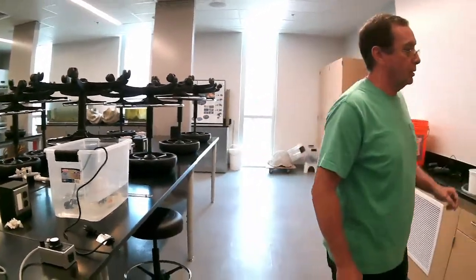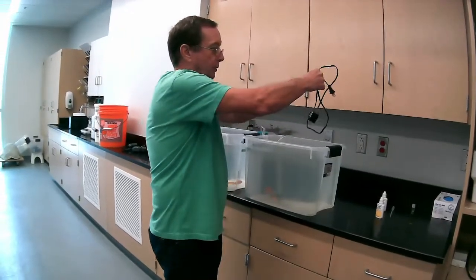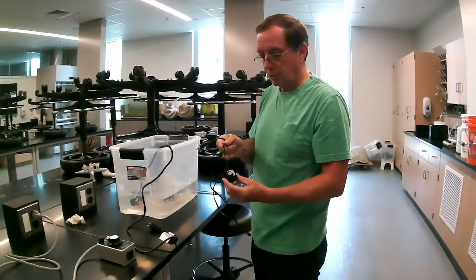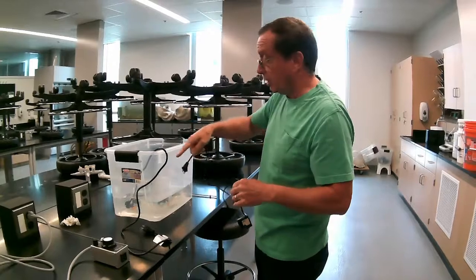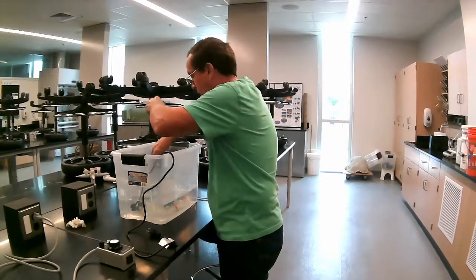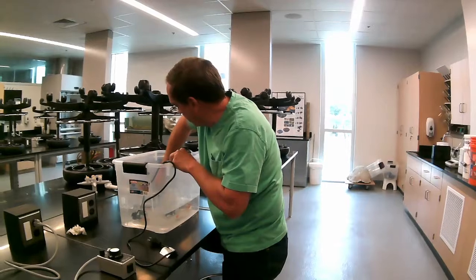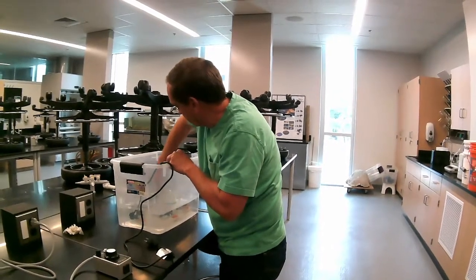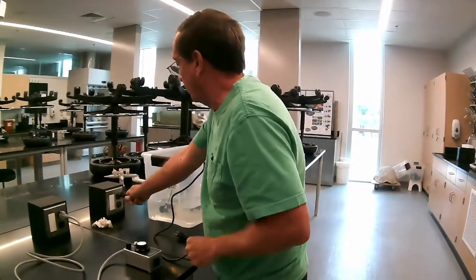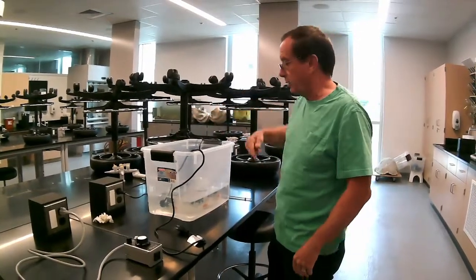We're going to go ahead and take a pump to circulate the water inside the water bath. This is just a tiny little mini pump that pushes water around so that we get even distribution of the temperature. I usually like to put it so that it blows across the heater itself. Okay, I'm going to go ahead and plug that in now. So we've got water moving across the heater and circulating inside the tank.